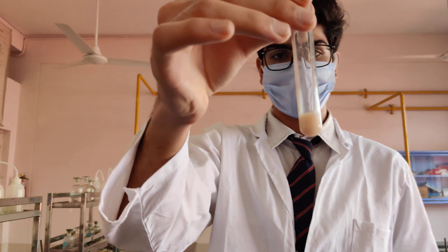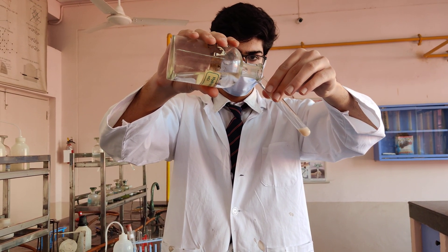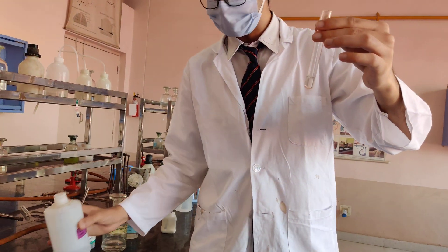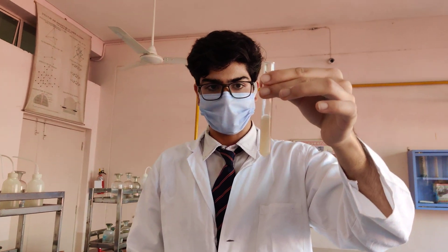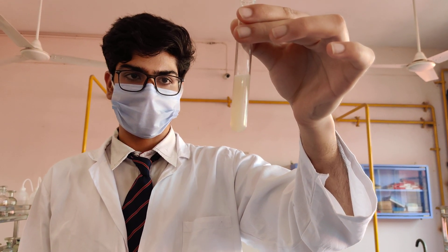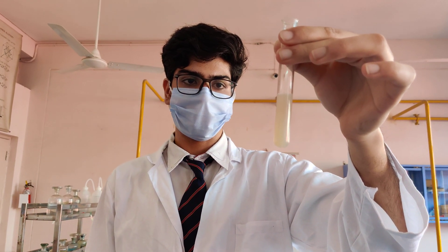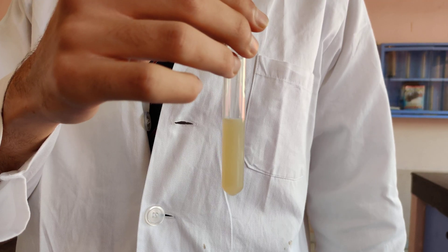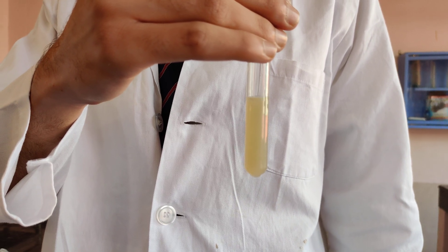To confirm this, dissolve the PPT in dilute HCl. It dissolves, and to this now add NaOH solution. You will need a little more NaOH to neutralize the HCl. The colour is pale white and it is changing to brown. If you leave it for some time, the colour goes brown due to aerial oxidation. The PPT formed initially is Mn(OH)₂, which is white, and on keeping, it starts to turn brown by combining with oxygen of the air to form oxidized manganese hydroxide. The colour is turning towards brown and if left another 5 minutes, it will definitely go towards a darker brown.